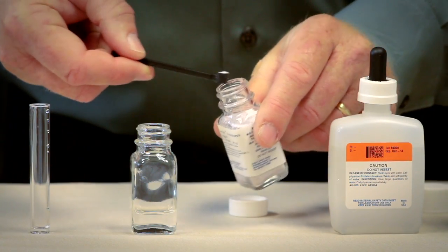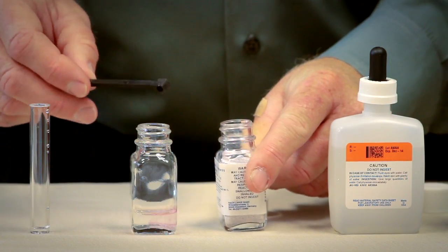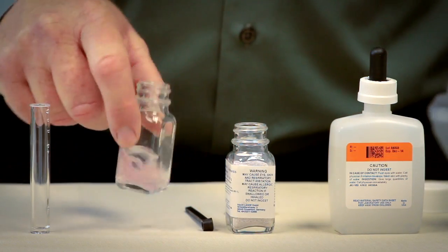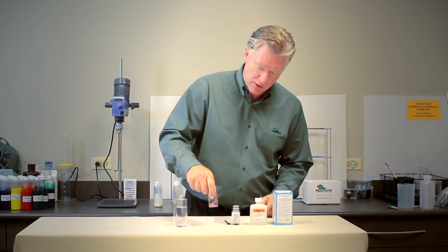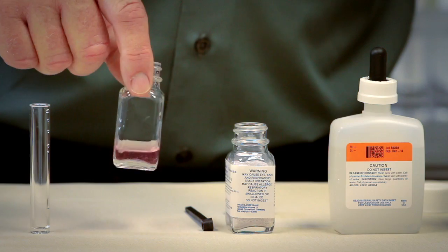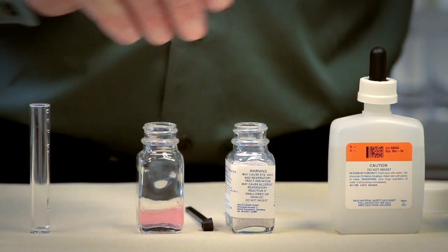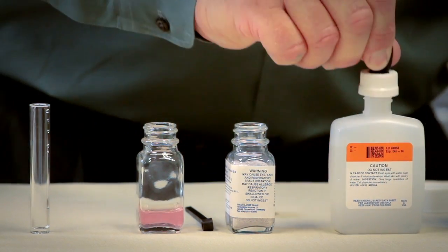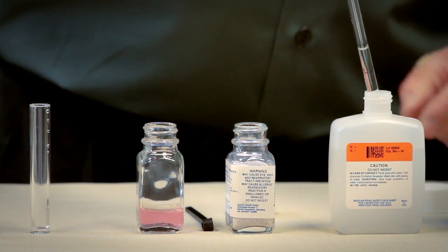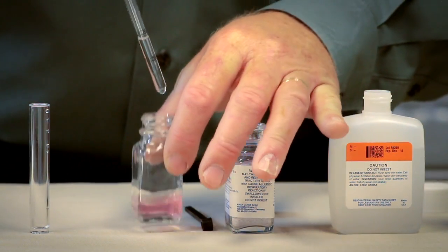If you're pulling water from multiple sites on your farm it's always good to do a test from each site you pull water from. Now it's turned pink and our goal will be to turn it back to a blue color and from this point we're going to start adding titration fluid. Every drop that we add represents one grain of hardness or about 17 parts per million.